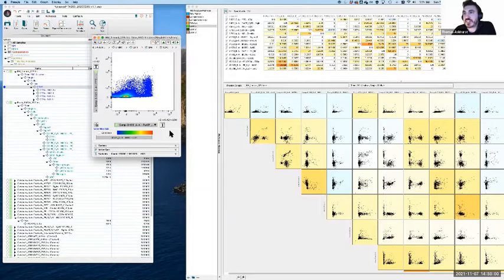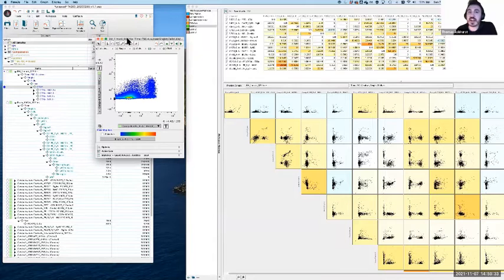So FITC and PerCP-Cy5.5 don't tend to spill into each other very much, and so it's unlikely to be that pair. Most likely we're looking for a fluorophore that spills heavily into PerCP-Cy5.5. It's not a guarantee, but the thinking is the more spillover you have, the more compensation you need to apply, the more chance there is to get it wrong. If you're simply not applying compensation, then there is no chance of error. If the application is 0, then you can't have an error in that application.